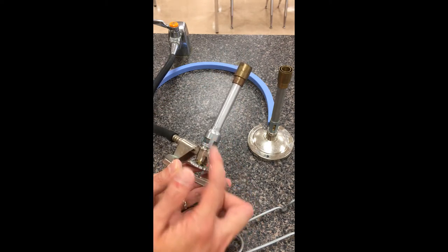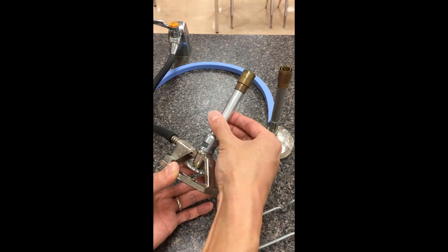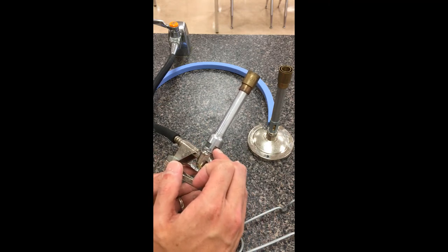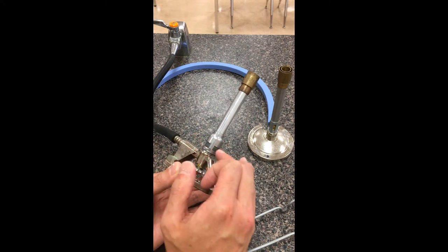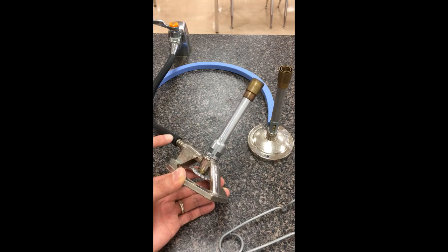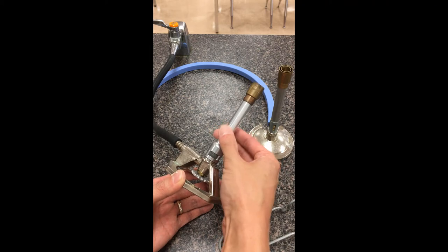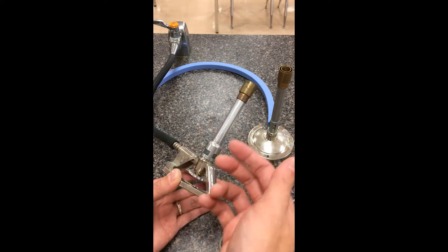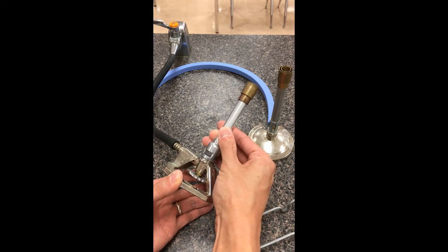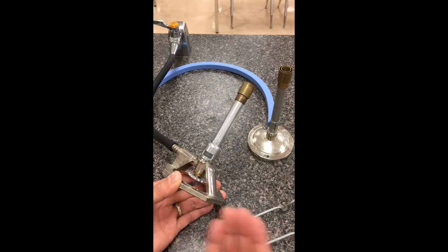The other thing we can adjust is along the top — this whole top portion can be loosened or tightened. What this second part controls is a tiny slit: depending on how open the slit is, a certain amount of oxygen can come in to burn with the flame. We need oxygen for combustion reactions. I generally tell people to keep this at its tightest setting. As we want to burn more oxygen and change up the ratio, I can steadily loosen this up, and as we'll see shortly, we can actually change it from an orange flame to a blue flame — wildly different in temperature.